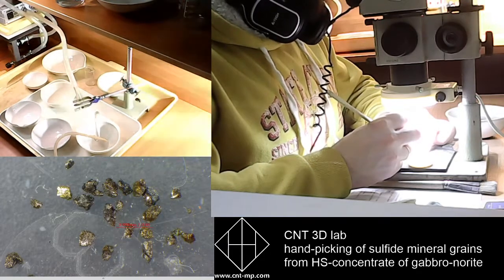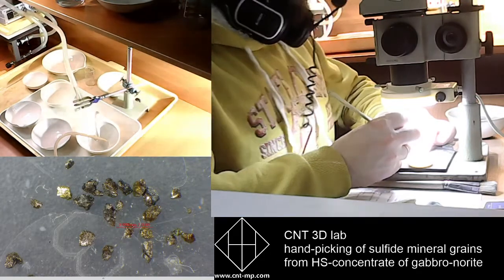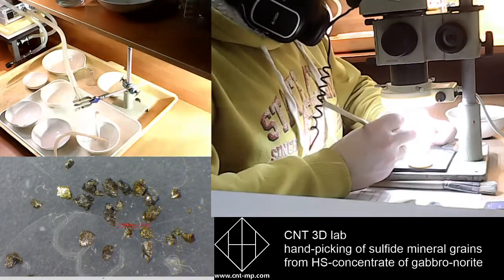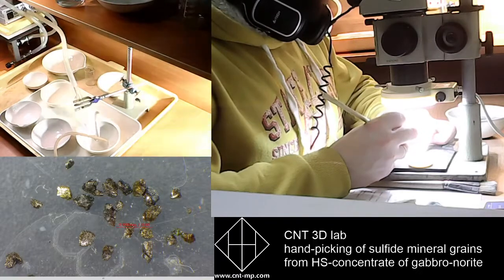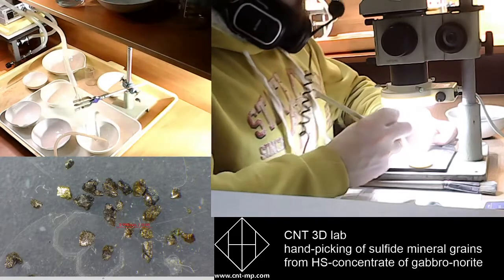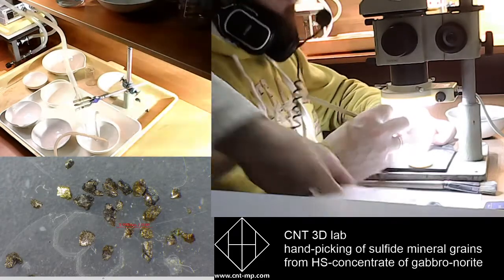There are a lot of chalcopyrite grains with characteristic rainbow skin. They are yellowish and they have rainbow skin.